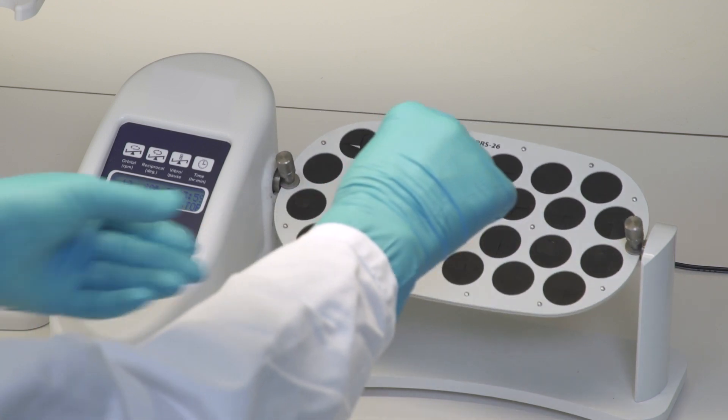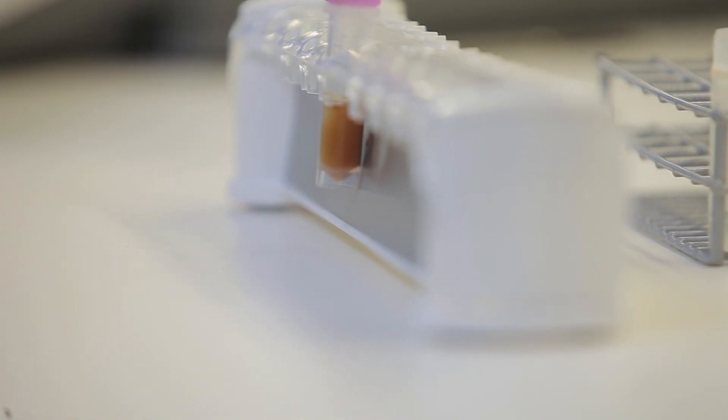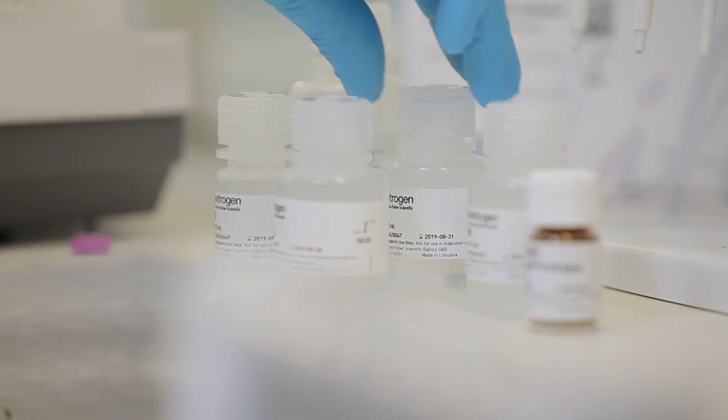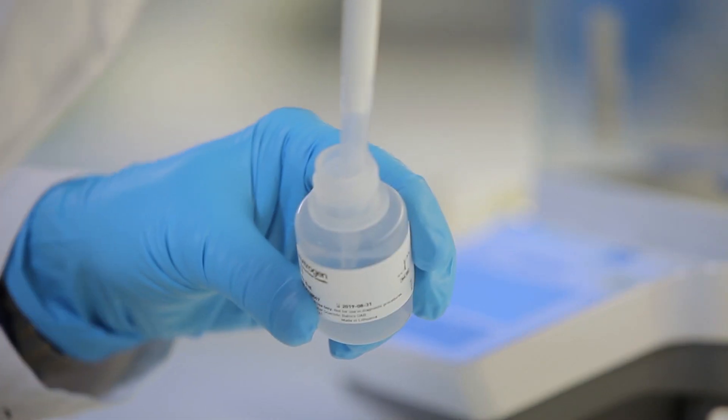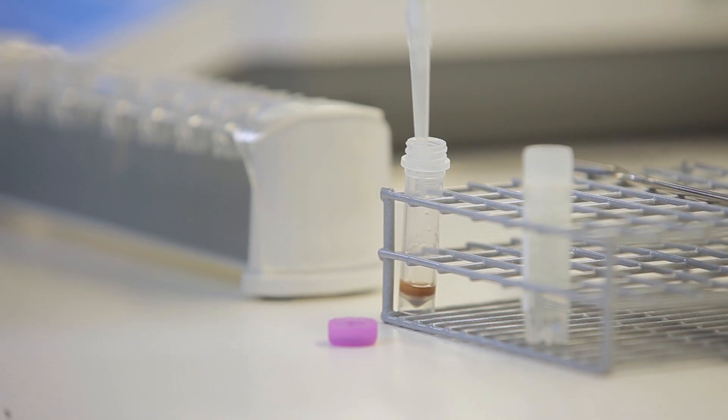To remove unbound antibody, the beads are washed with three of the included buffers before use or storage. It is critical to follow the recommended washing steps to minimize antibody leakage and to achieve ultra-low nonspecific binding.